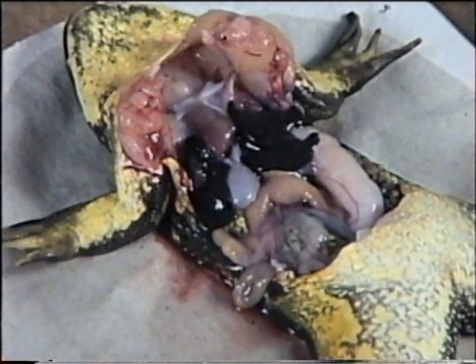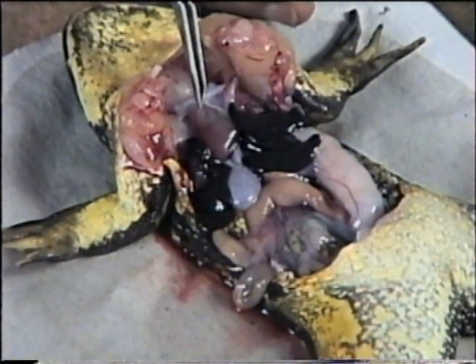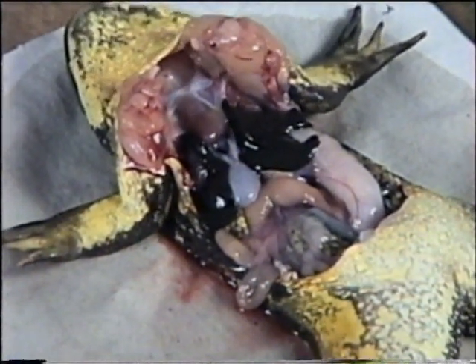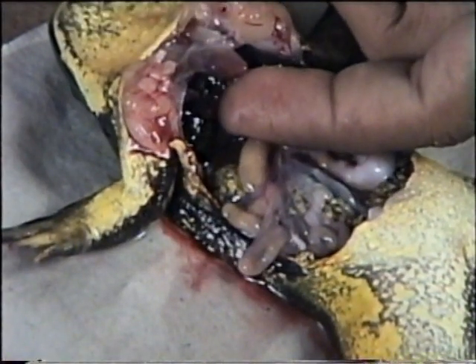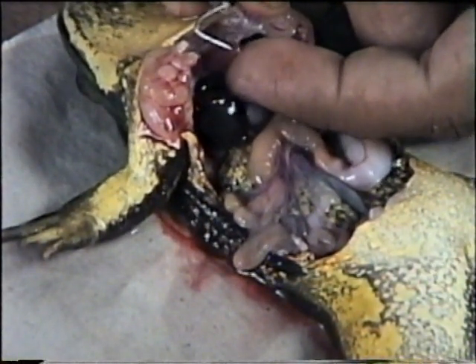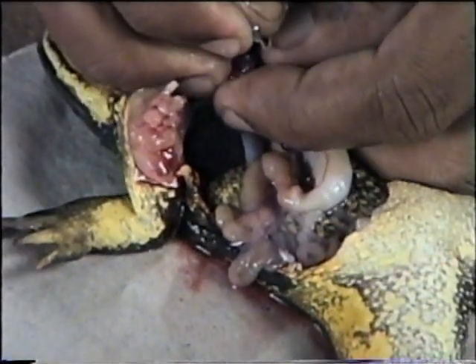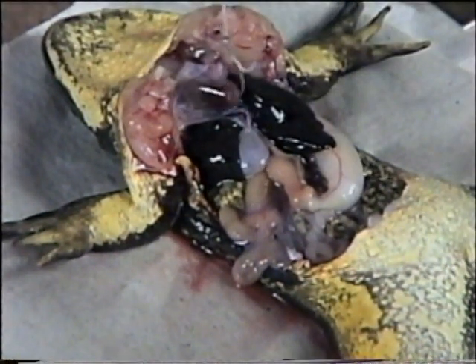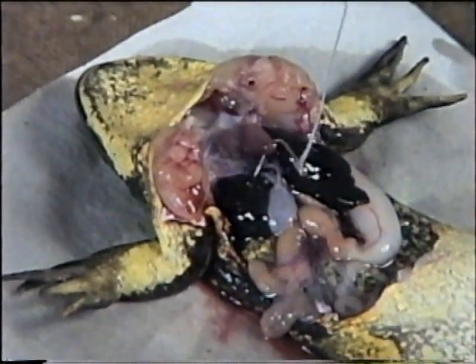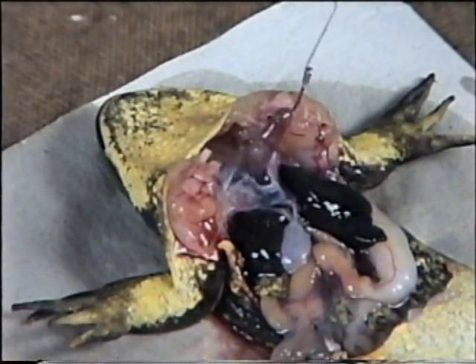See the parts of the heart — this is the auricle and the ventricle, this is the bulbus arteriosus, and this is the groove between the auricle and the ventricle. Bend it and then pierce the apex of the heart and slowly take it out. The other end is tied with a thread. You are able to see the sinus venosus.